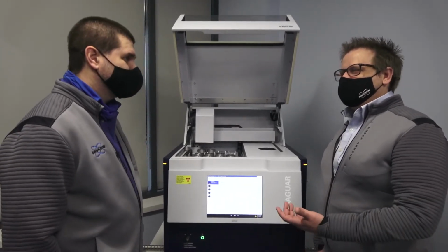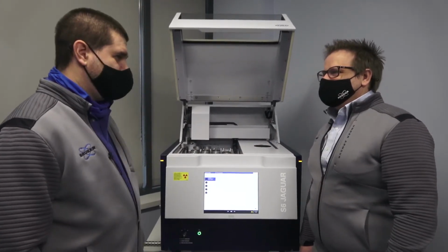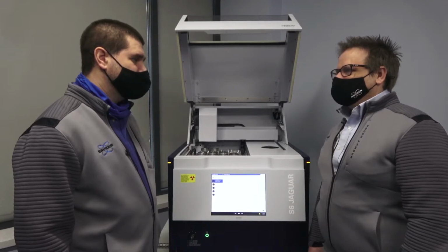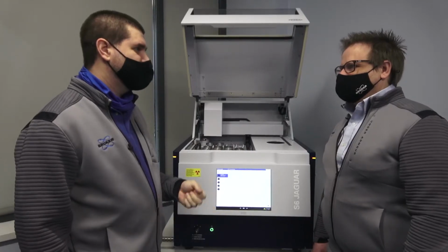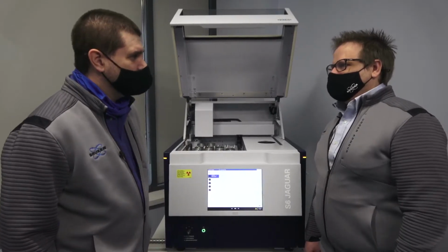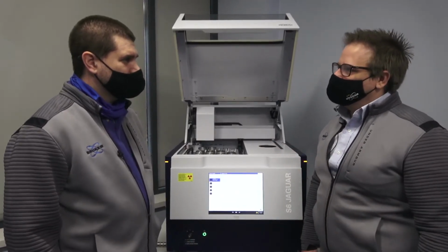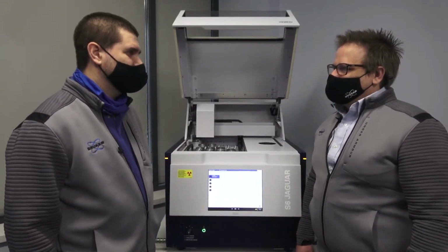Yep. So what does somebody in cement look for in a machine like this? Like what are they actually trying to measure? Well, for cement, there's an ASTM norm called C114, which they like to follow. And so we follow that guideline for the analysis. So they're looking at elements like sodium, magnesium, aluminum, silica, phosphorus, potassium, calcium, manganese, iron, those elements in their samples. Okay, and their customers, the cement customers, might actually be looking for that analysis to make sure it dries correctly and cures right. Yep, all that information is important for them to do what's right for the cement. Yeah. All right.